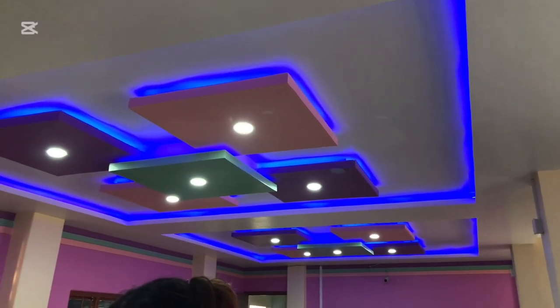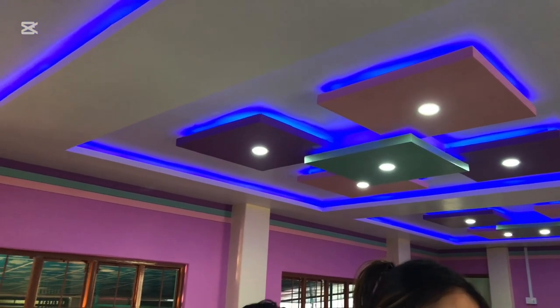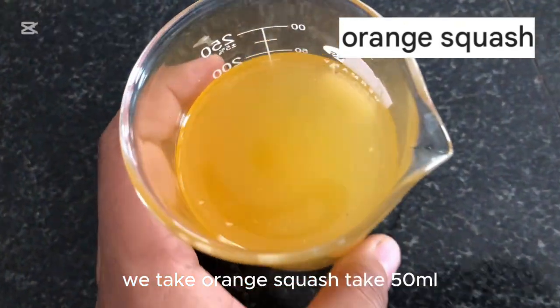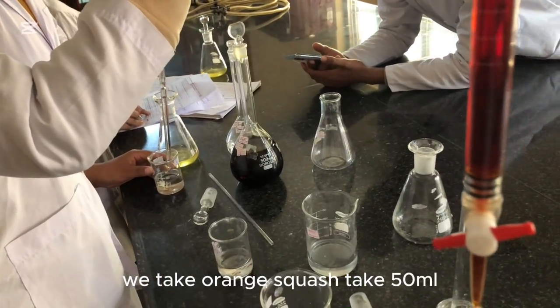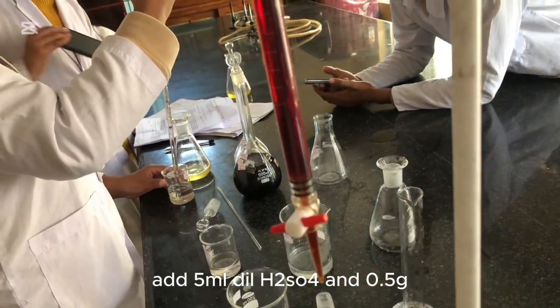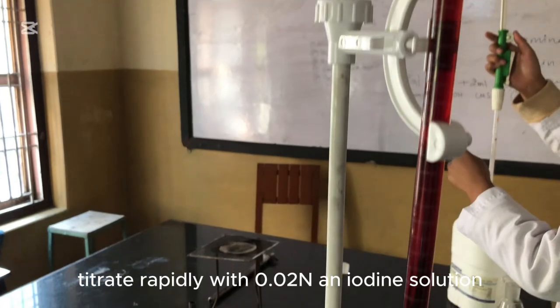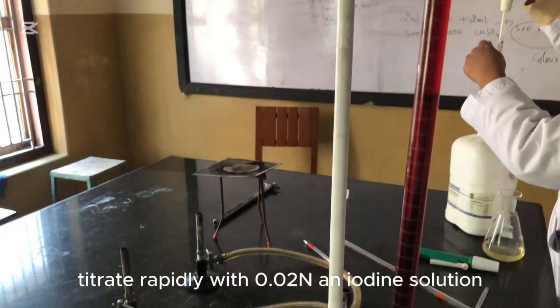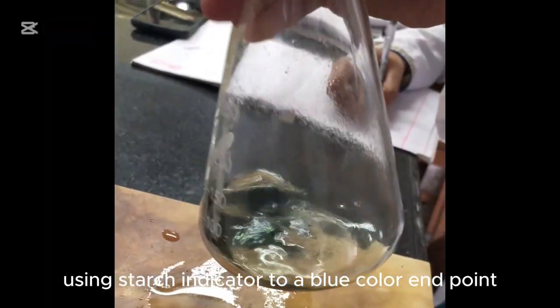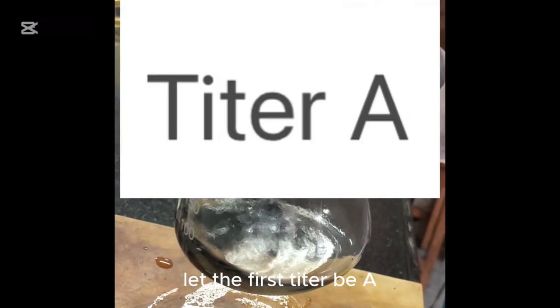After chemical preparation, begin the free SO2 determination. Take orange squash as the sample; take 50 ml of sample, add 5 ml dilute H2SO4 to the sample and 0.5 g sodium carbonate in the iodine flask. Titrate rapidly with 0.02N iodine solution using starch indicator to a blue color endpoint. Let the first titer be A.